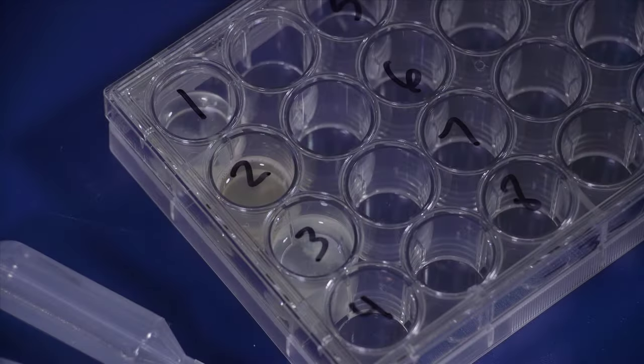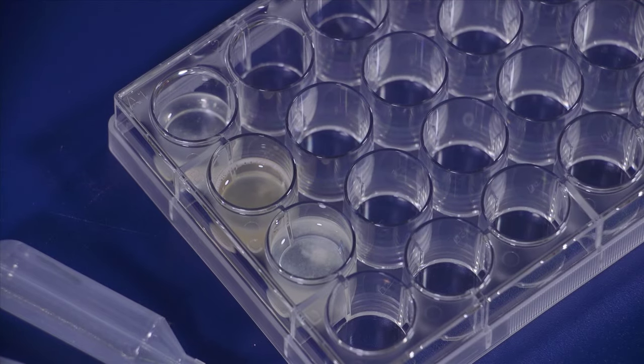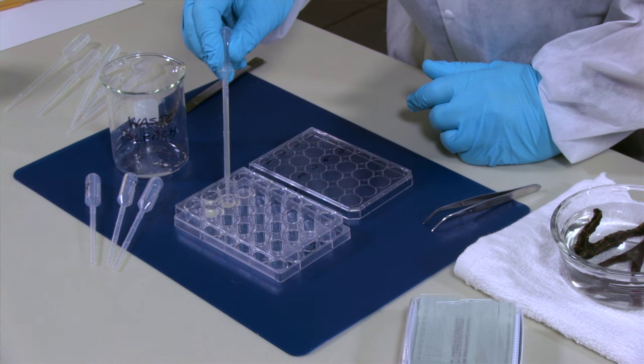Now that the tissue is dissolved we can remove the bleach. You just want to use a pipette and carefully suck up this bleach without disturbing the spicules underneath.